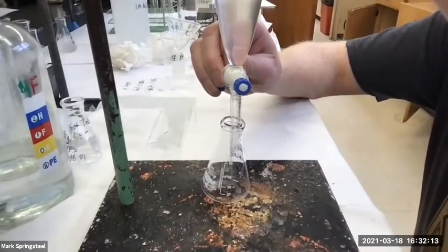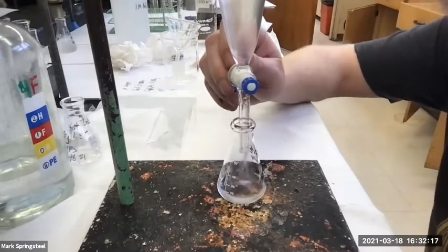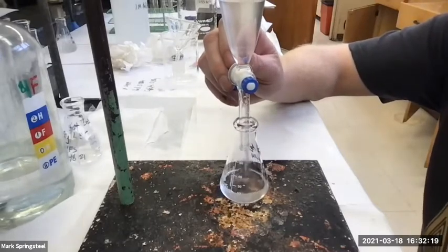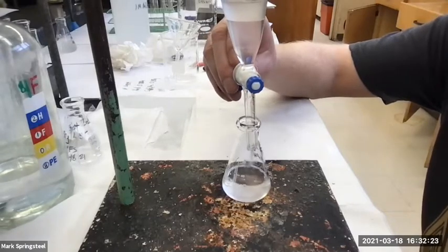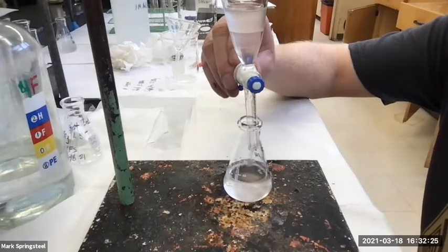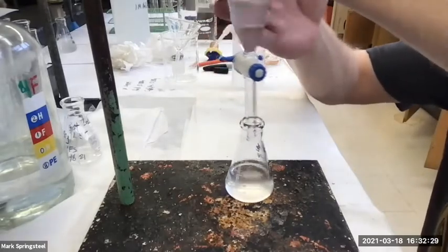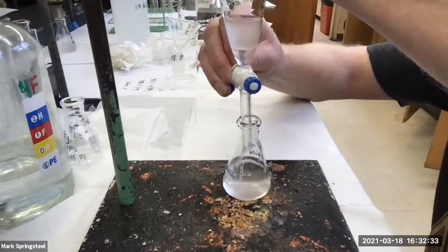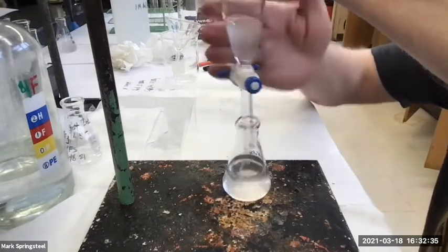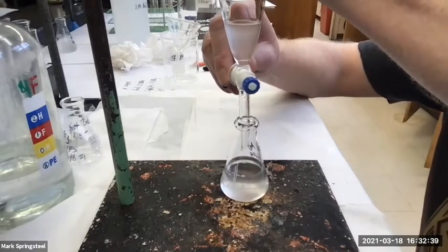There we go. And that lower organic layer out. Go, go, go. Oh, yeah, now you see the aqueous layer on top coming into the picture, huh? And then about an inch left of the organic. I'll stop and give it some taps. Do a little more. Stop and give some taps. Some of those beads of organic fall through.